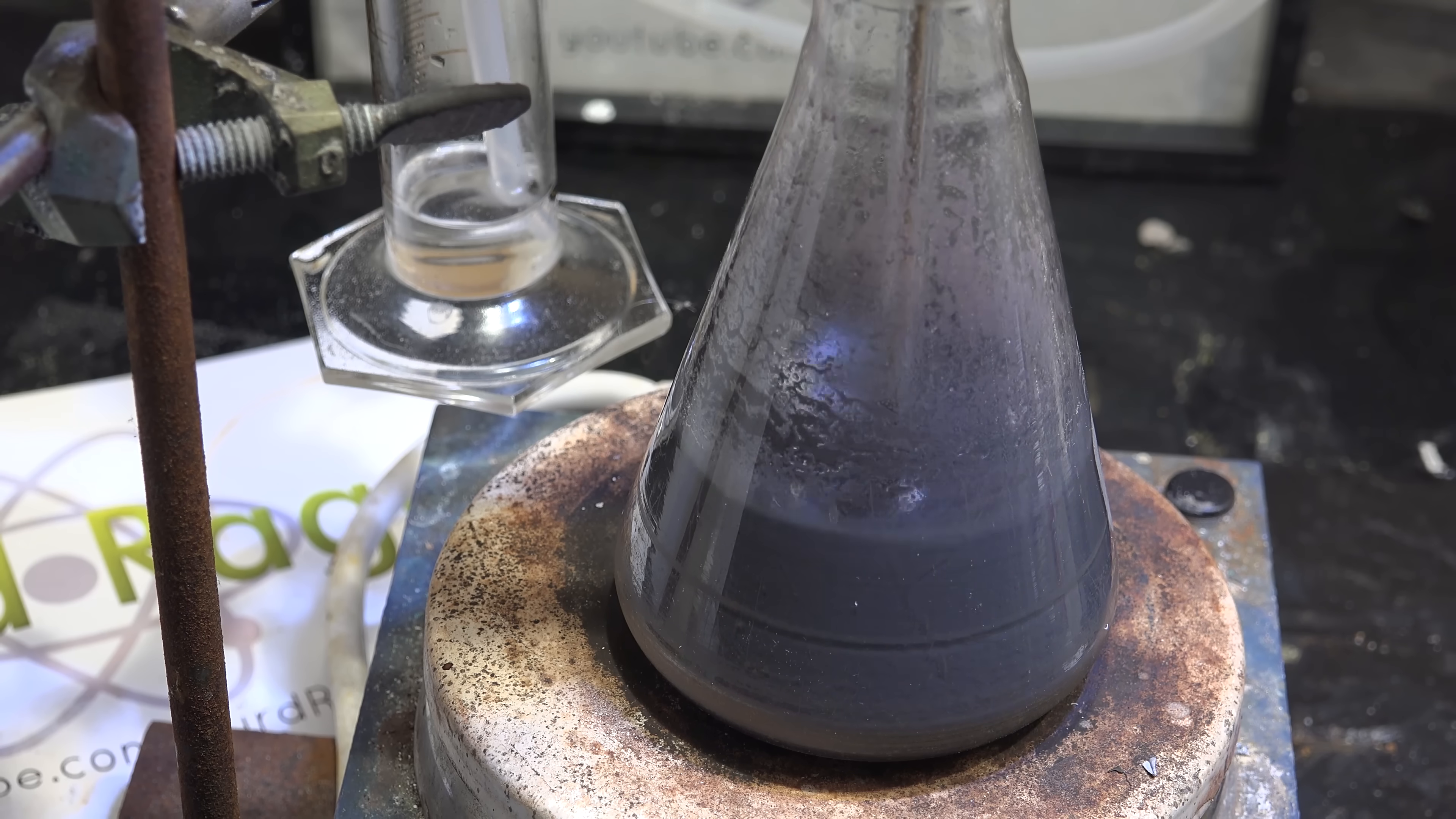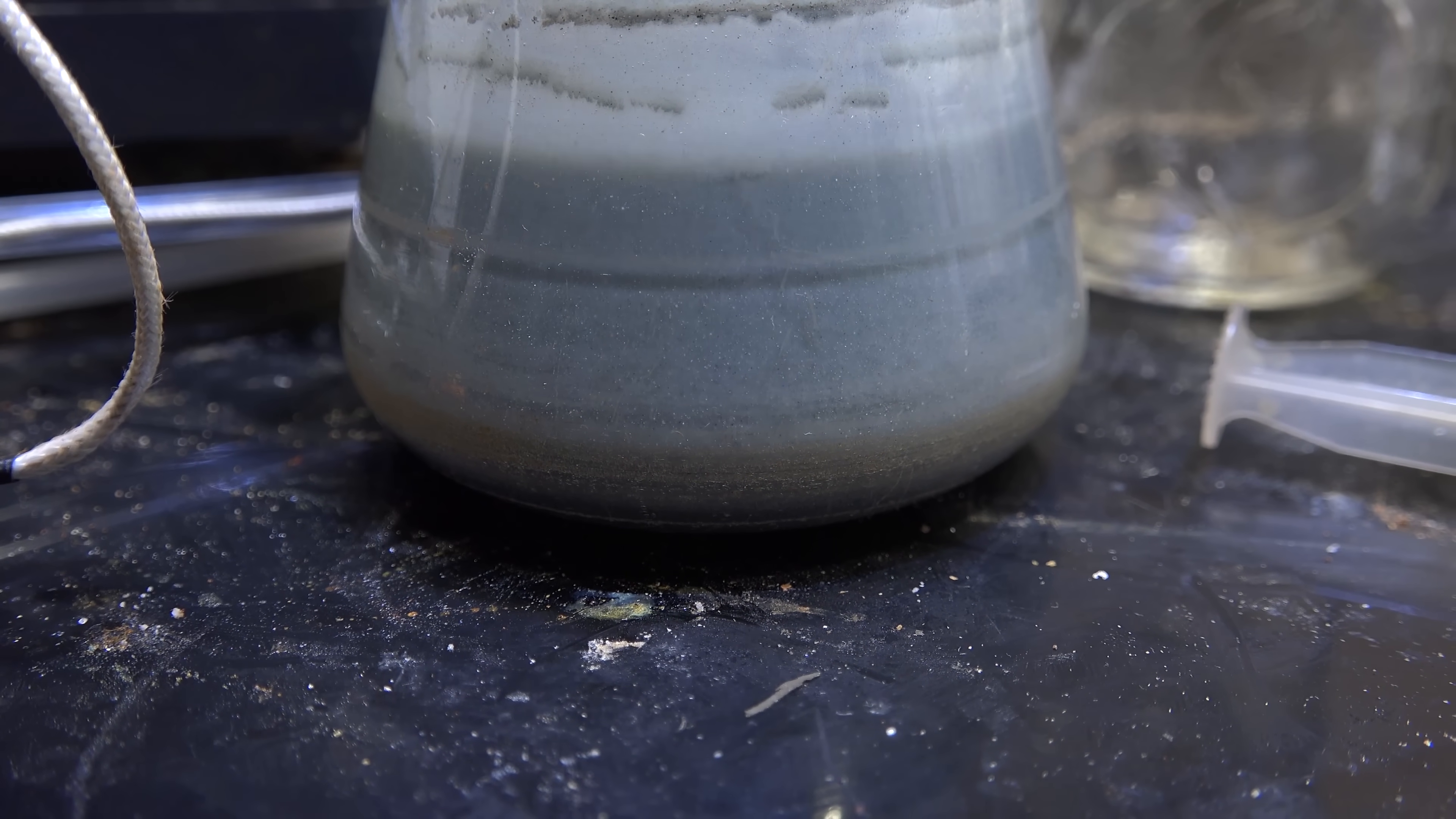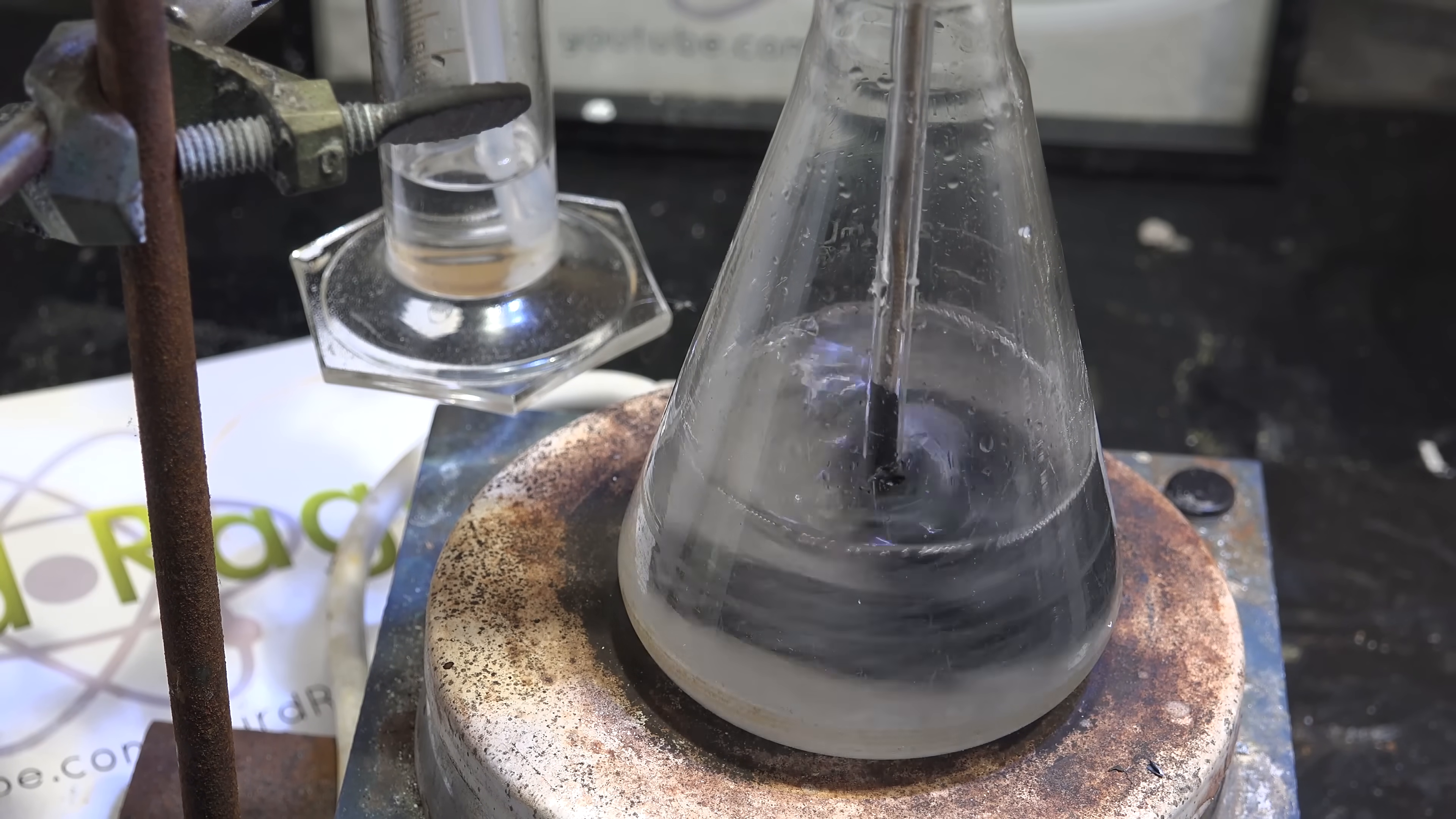I let it run for a couple of days until it stopped producing hydrogen and indeed we could see sodium in the reaction mixture. Interestingly the sodium is in tiny droplets and not coalesced into larger globules. I think lithium hydroxide interferes with coalescence. I couldn't get any large sodium spheres even after straining. Overall this experiment does give strong evidence for the necessity of some sort of catalyst. It doesn't prove exactly what role the catalyst plays, just that it's needed.